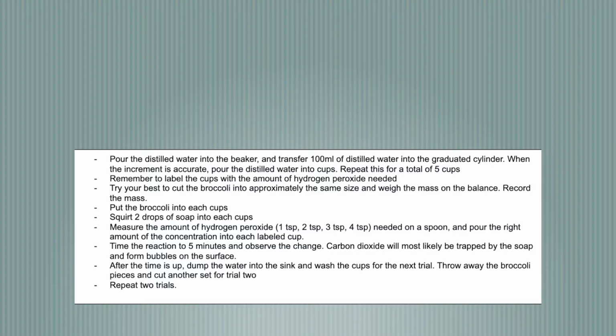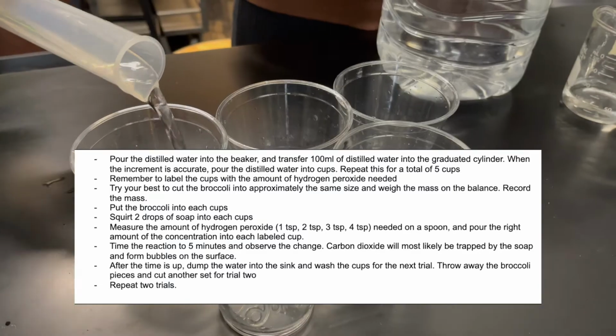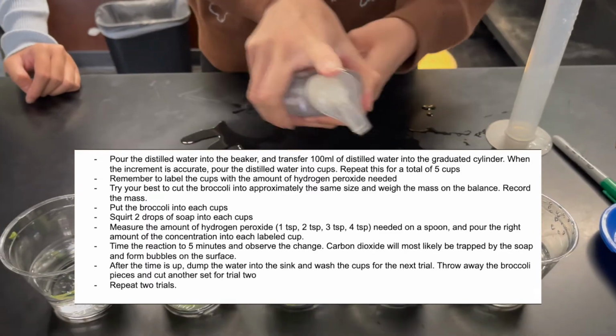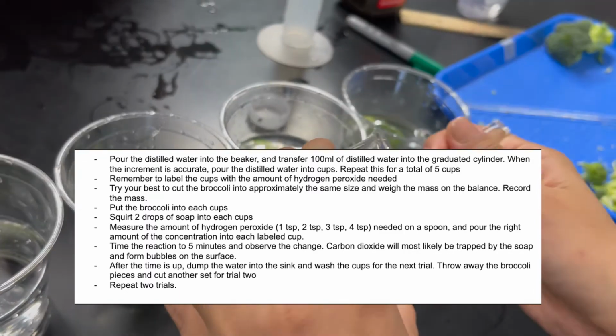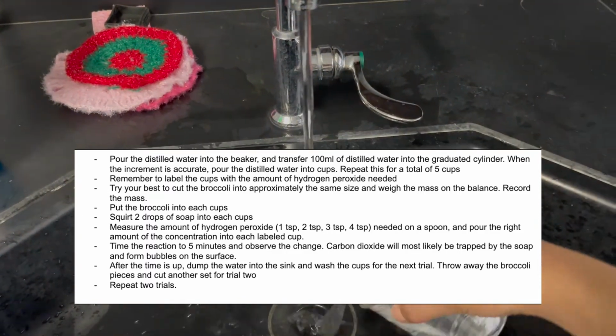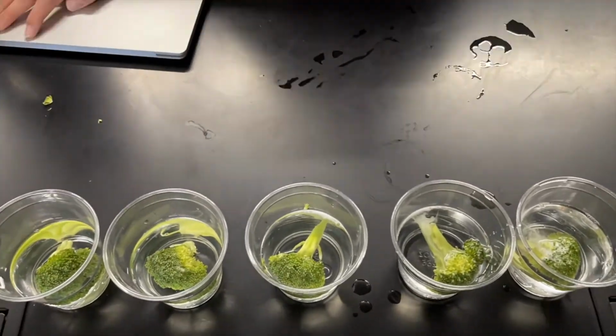And these are the steps to the experiment. Start out by measuring and pouring the water into the cups and then label each cup with the amount of hydrogen peroxide you will put in them. Then drop all the broccoli in at the same time and squirt 2 drops of soap into each cup. Measure and put the respective amount of hydrogen peroxide into each cup and then set a timer for 5 minutes. After the reactions have completed, make sure to clean up, throw away the water, and then repeat the experiment twice.